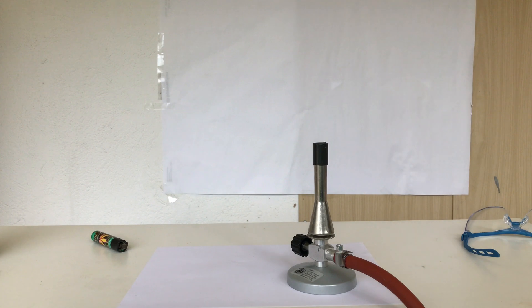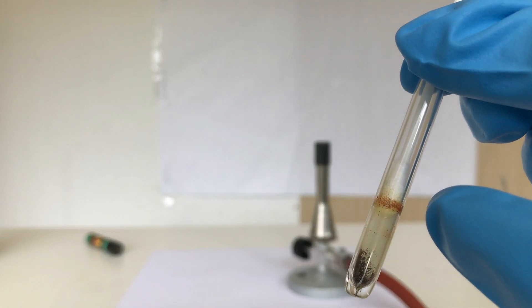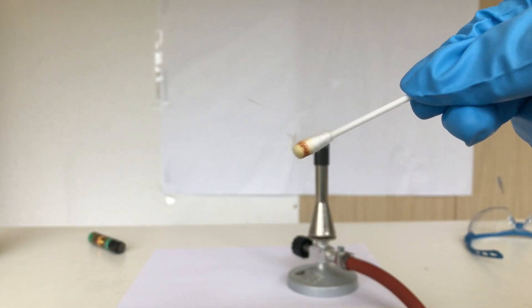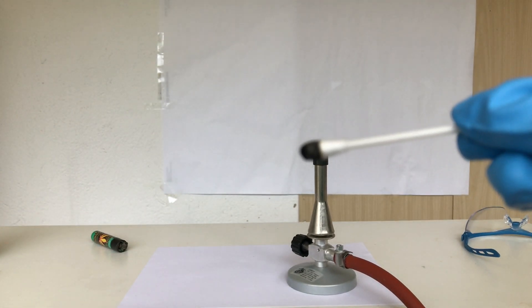Because all of this was so fun it seemed like there was a bit more white phosphorus, so I put in a second q-tip and let's light it up. This one took a little more time to light up.